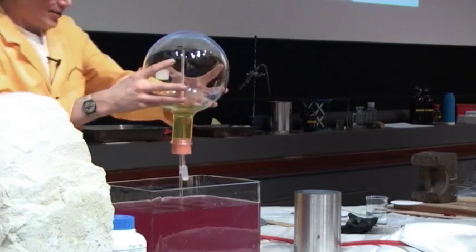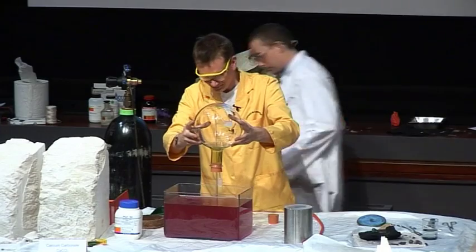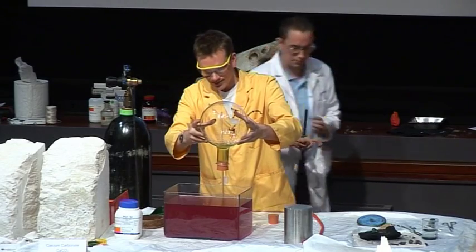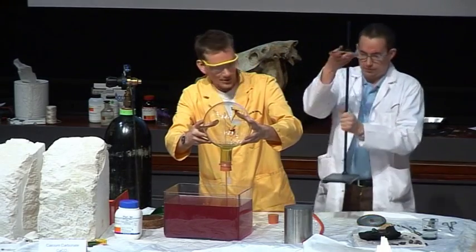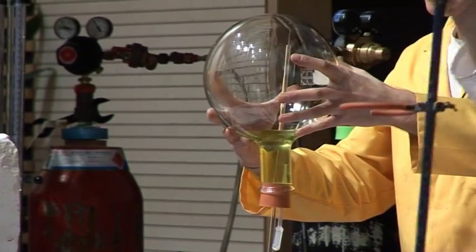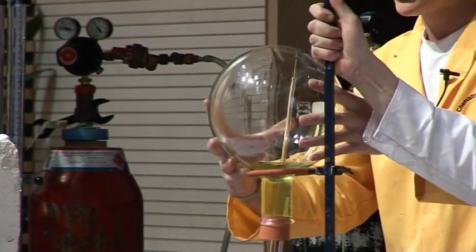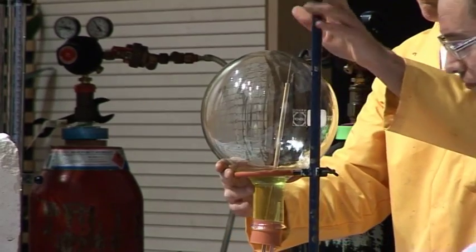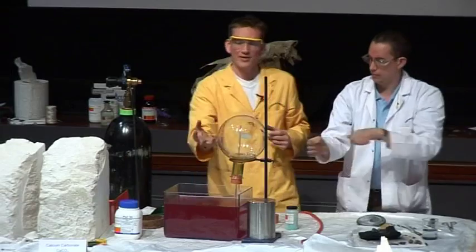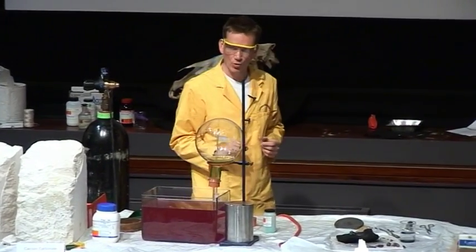I think I need to clamp this, please, Mark, otherwise I'll be stuck here all day. So if we just put this in... thank you, that's great. We'll just leave that there, and that will gradually fill up as the ammonia dissolves in the water.